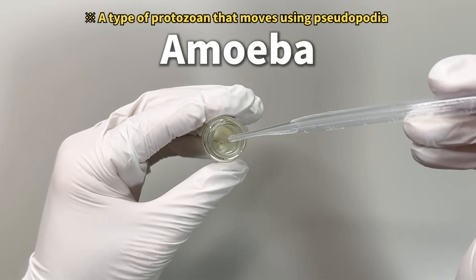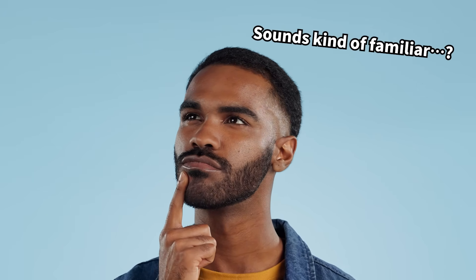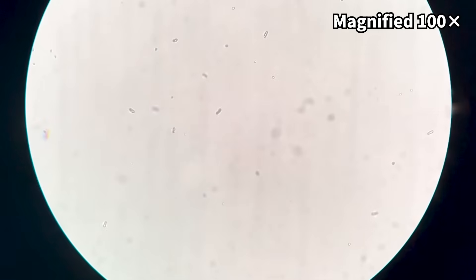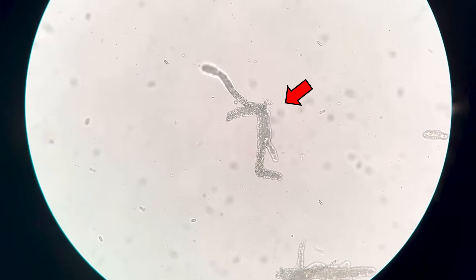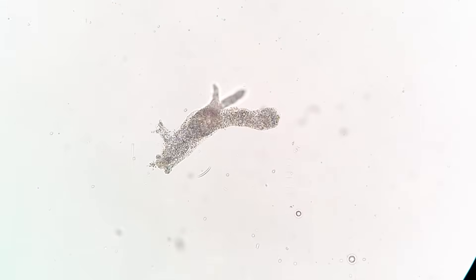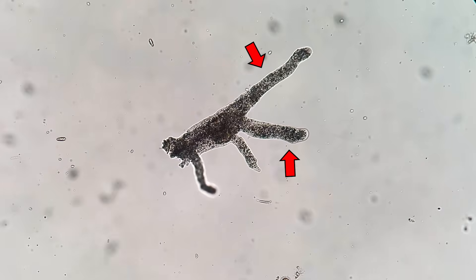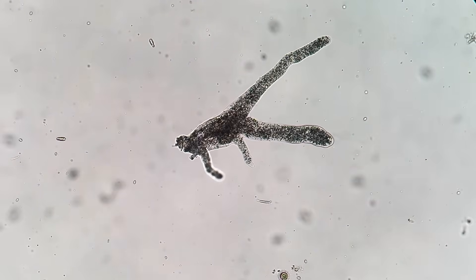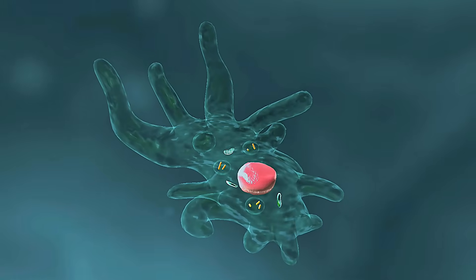Amoebas are fairly well known, but not many people have actually seen one alive and moving. We placed a drop of water containing amoebas on a slide, then looked at it under a microscope. Can you see that strangely moving creature? That's an amoeba. Amoebas have no fixed shape and are constantly changing their form as they move. These extended parts are called pseudopodia, or false feet. Amoebas use these pseudopodia to engulf their food.